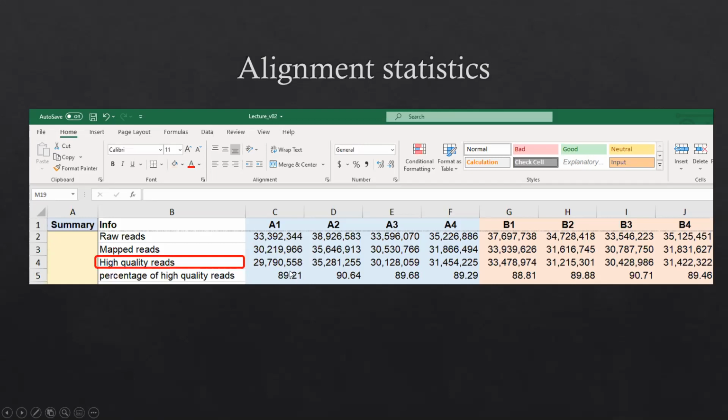There is some information you have to be careful about. The first one is the total reads. As Dr. Yuno emphasized before, we need to think about the sequence depth. So here you can see even the sequence depth is over 30 million, but after mapping, the depth will probably drop a little bit. We hope each sample has at least about 25 to 30 million reads that can be used for further analysis.